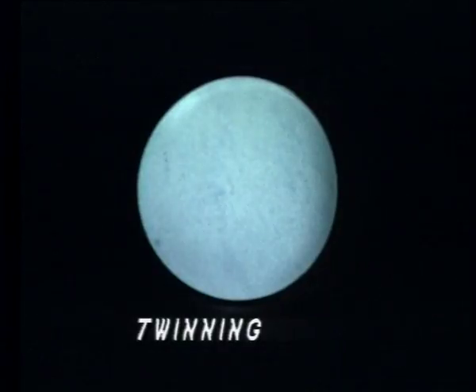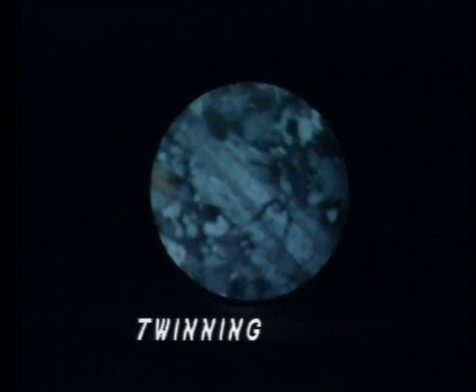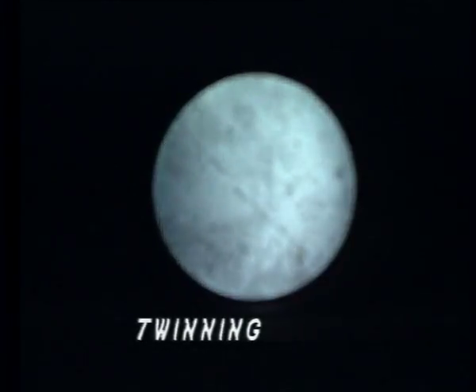Twinning is another feature observed in crossed position. In a normal crystal, the entire grain of a mineral will have a common crystallographic orientation and therefore arrive at the extinction position at the same time. Twinning in minerals represents a deviation from normal crystal habit. In twinned crystals, different segments of the same grain will have different crystallographic orientations. Therefore, when some portion is in extinction position, other portions show interference color. There may be two or more twin components within a mineral grain. Feldspars show different forms of twinning — plagioclase feldspars invariably show multiple twinning, while orthoclase shows simple twinning.